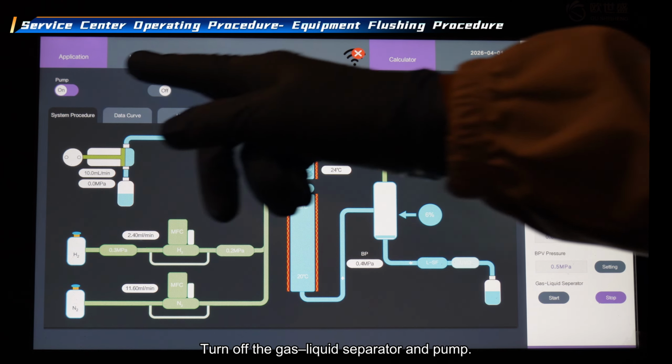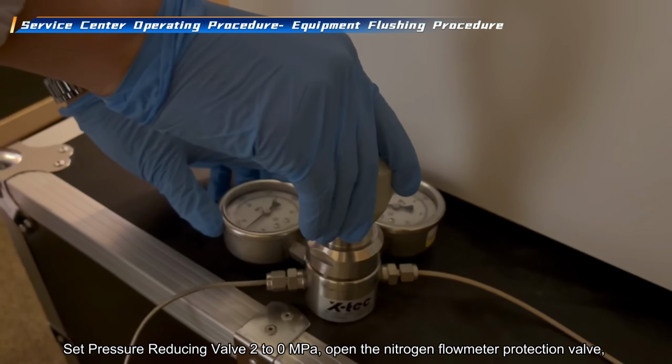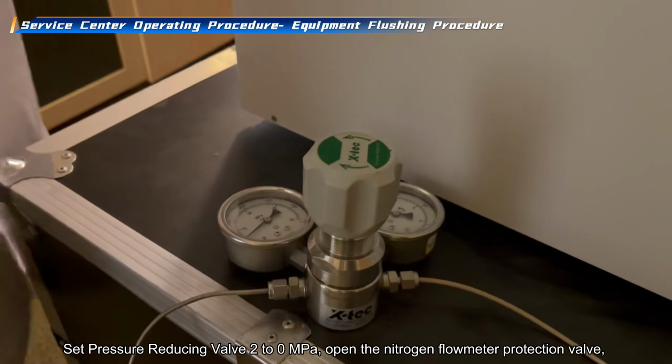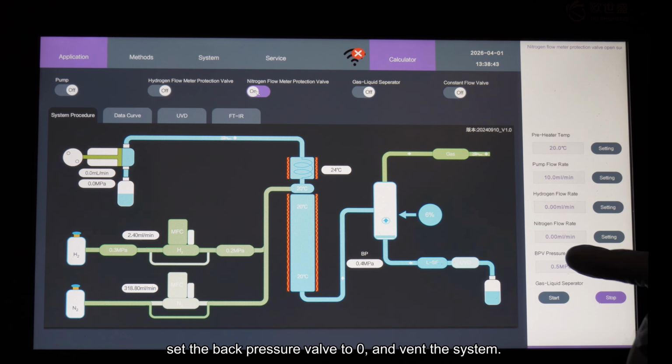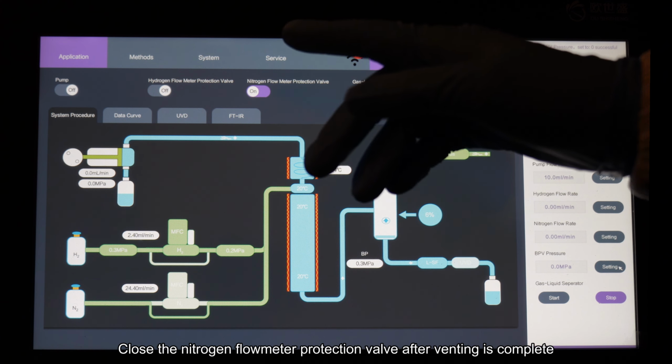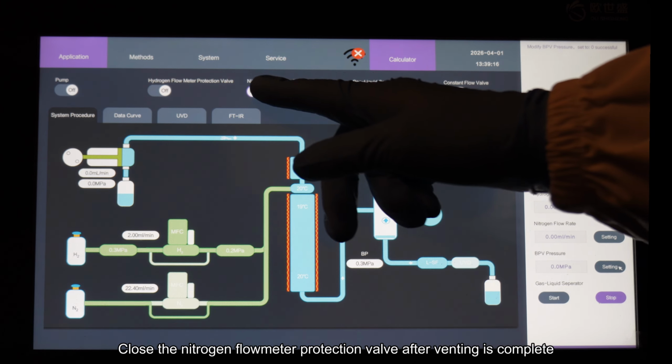Turn off the gas liquid separator and pump. Set pressure reducing valve 2 to 0 megapascal. Open the nitrogen flow meter protection valve. Set the back pressure valve to 0 and vent the system. Close the nitrogen flow meter protection valve after venting is complete.